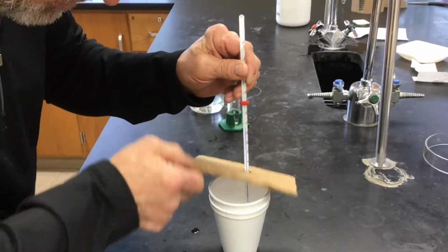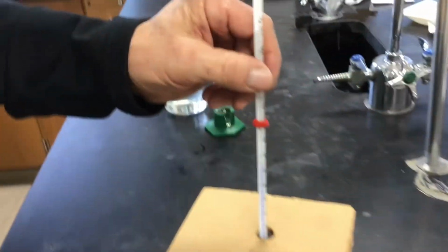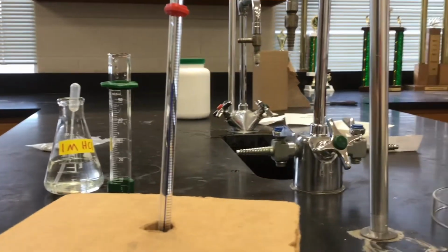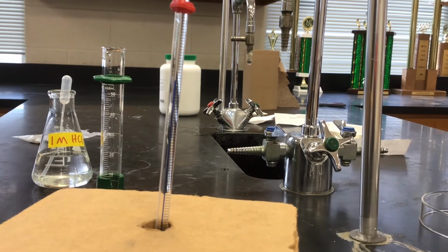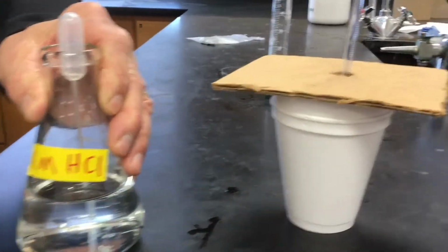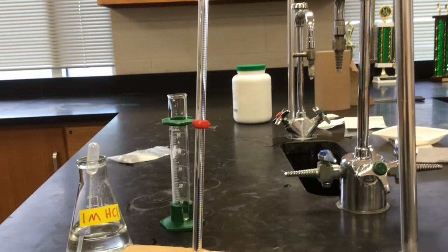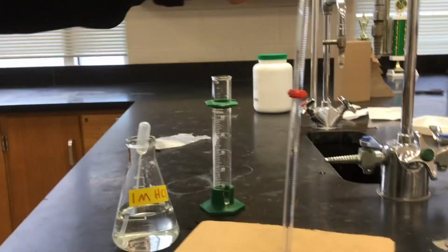Okay, I think it's got to be about done reacting. So we're looking for the highest temperature on the thermometer. We didn't take the initial temperature of the acid. Did we forget to take the initial? Well, you know what we can do? We can probably just stick it in here when we get done. We don't want to let you off the hook with any measurements, so we'll check that. We'll get it for you. Can you rotate that for me so we can see the numbers?